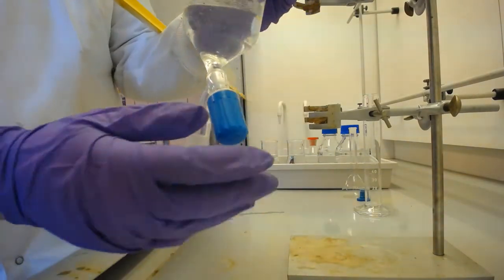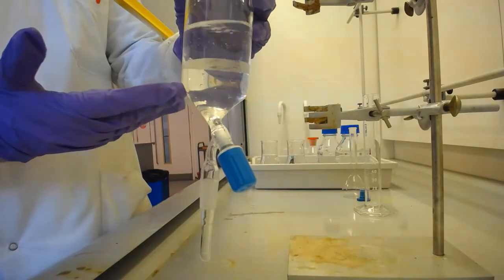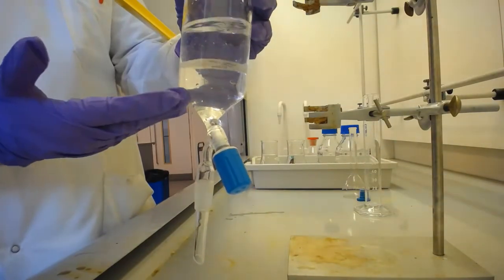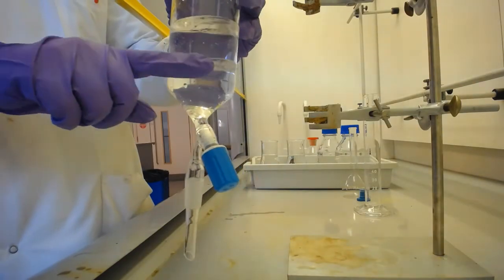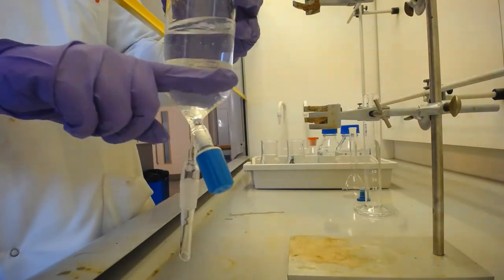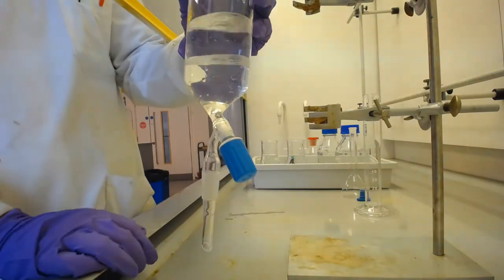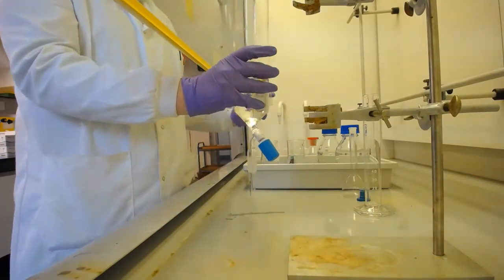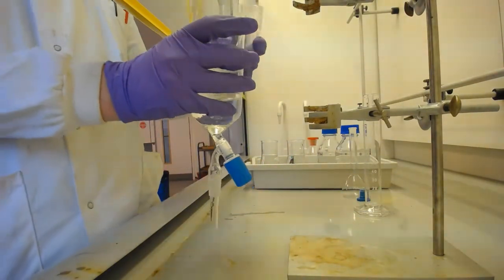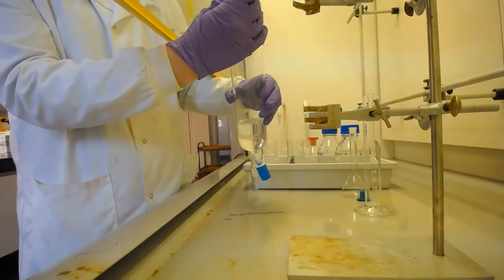Okay. Now, we want to give the opportunity for the trimethoprim to dissolve in either phase we have here. And whilst we've just got this interface here, we haven't got much opportunity for diffusion across the two phases to happen. So the next stage is to stopper this separating funnel and to shake it.